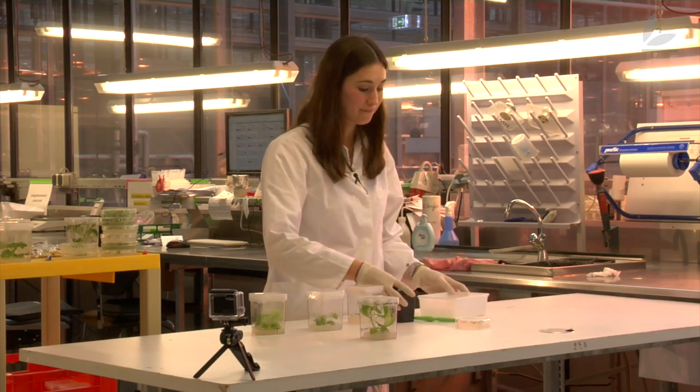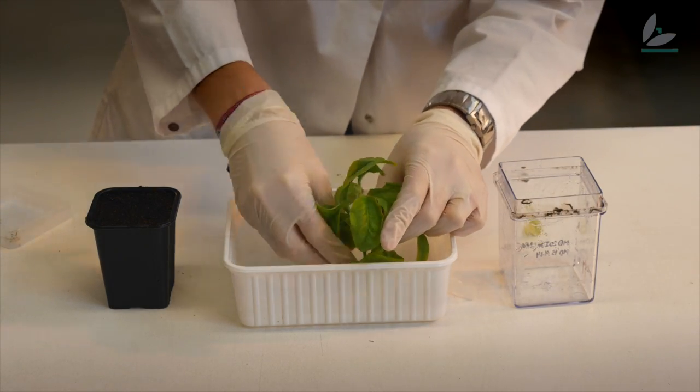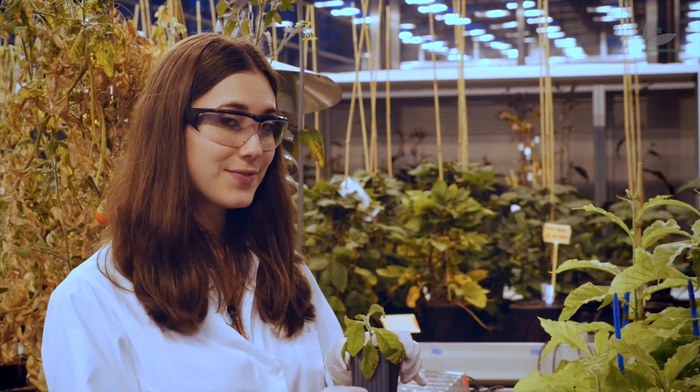Here you can see a two-week-old plant, four weeks old, six weeks old, and eight weeks old. This plant is now big enough that I can take it into the greenhouse, and in order to do so I have to put it into soil first. Here is my plant and I bring it to the greenhouse.